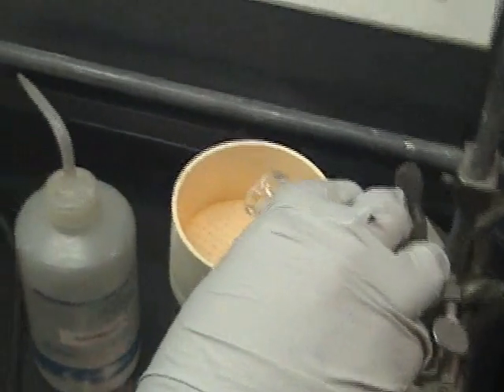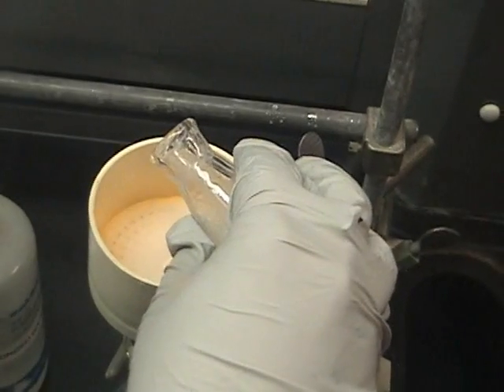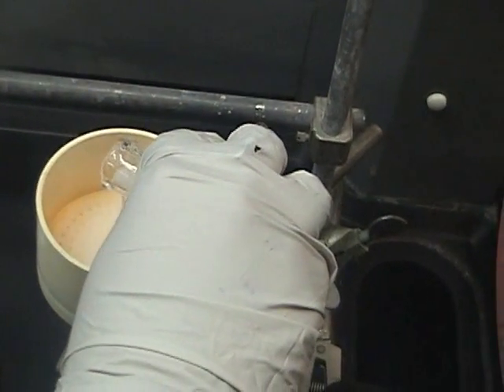Once the crystals have finished forming, collect them by vacuum filtration. Pour the crystals in the center of the filter paper so they don't go through to the bottom of the flask.